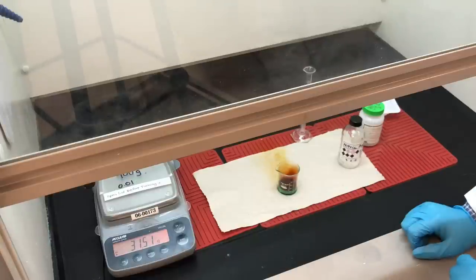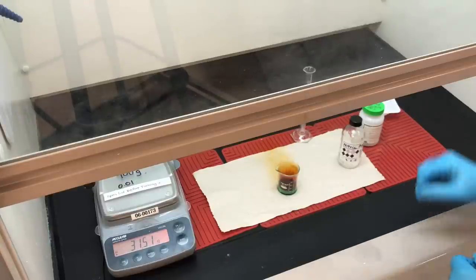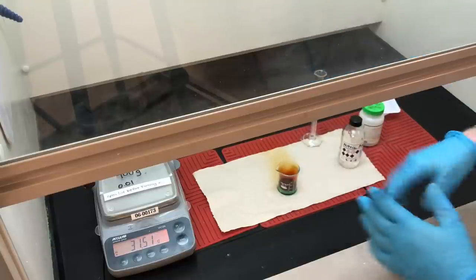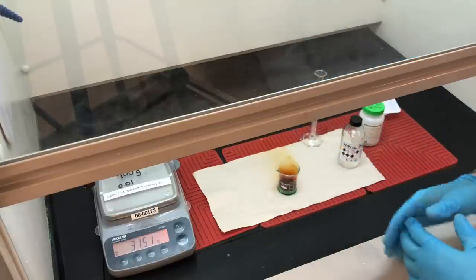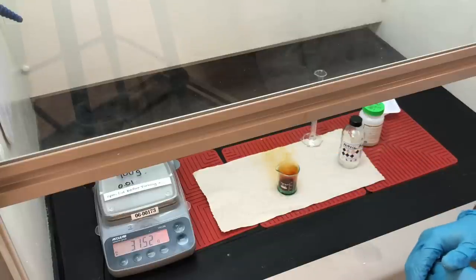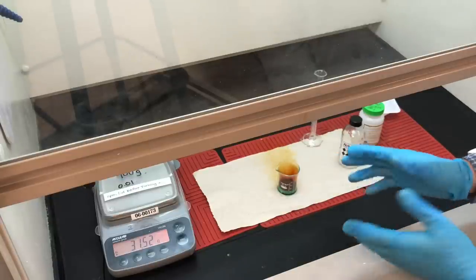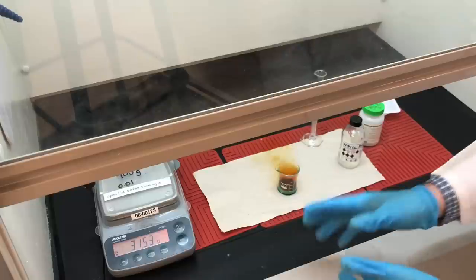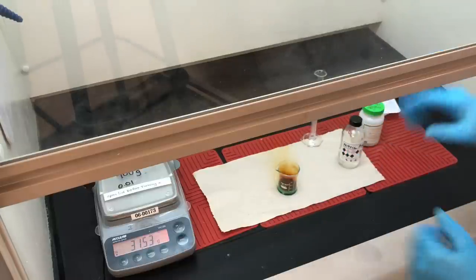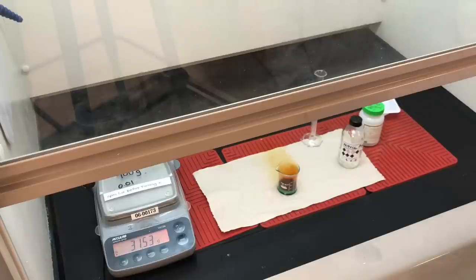I'm going to leave that sitting for several minutes and come back. If when the reaction has died down there are still some undissolved brass pellets, I'll add a little bit more nitric acid. Otherwise, we're going to add some distilled water to it later as well. We've dissolved brass pellets in concentrated nitric acid in a fume hood, and you can see the reaction progressing quite impressively.